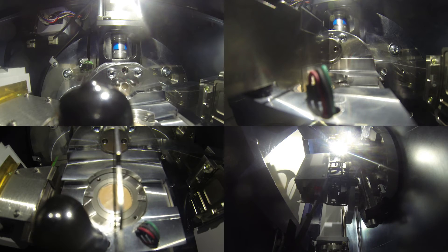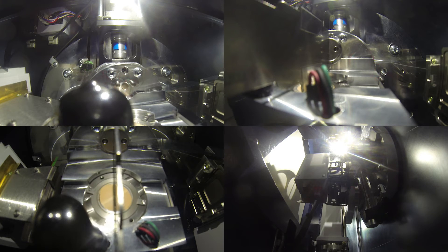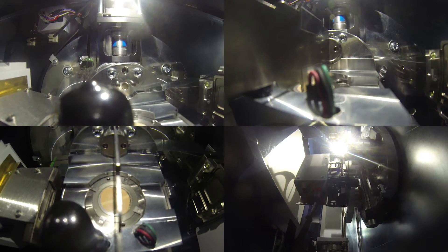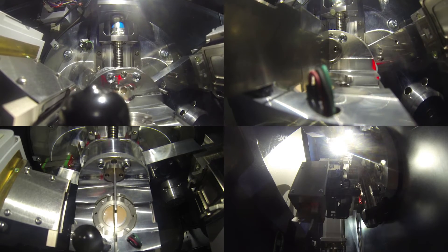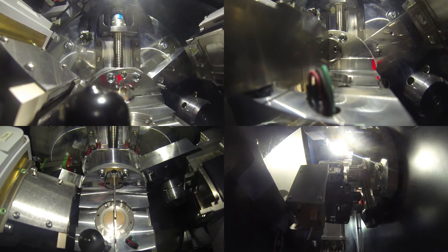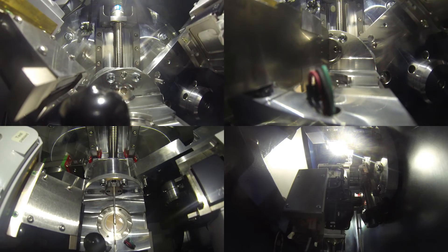This is what the inside of an XRPD cabinet looks like. This cabinet is shielded so you can't see inside it, but it also means that the x-rays can't get out. I've put my GoPro inside and used it to record four different camera angles. On the bottom left-hand corner, you can see the spinning sample — this sample spins so you can get a statistically random distribution of diffraction events. On the top left corner, you can see the lead screw that causes the goniometer arm to descend. On the bottom right corner, you can see that goniometer arm assembly descending. And on the top right-hand corner, you can see the detector side of the goniometer arm rising up as it scans the two-theta angles.